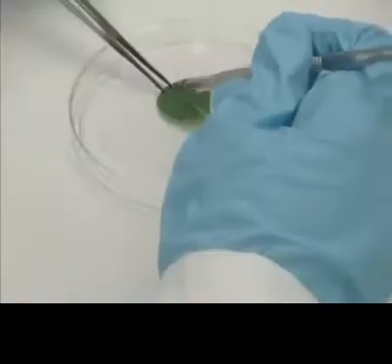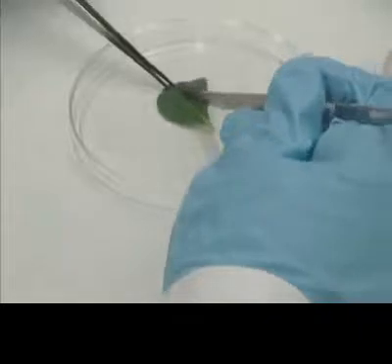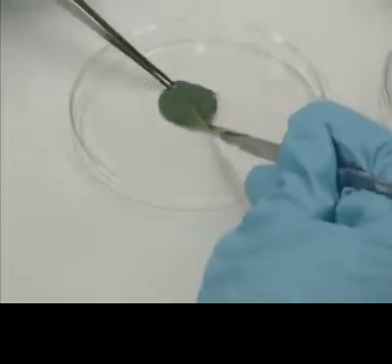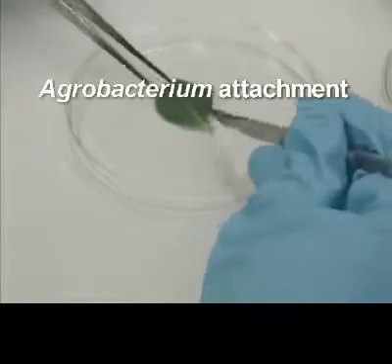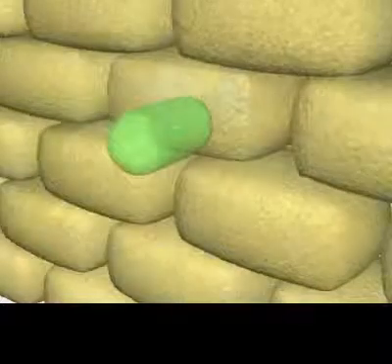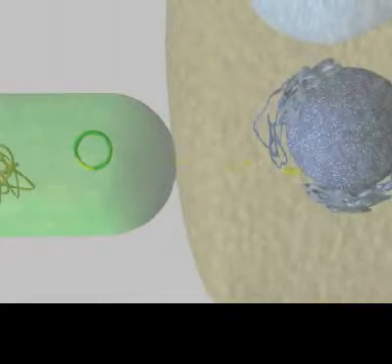Next, explants must be inoculated with Agrobacterium. A scalpel is used to pick a colony from the plate and then wound the leaf of a plant. Agrobacterium then attaches to the plant's cell wall and transfers the T-DNA portion of the Ti plasmid to the host. This T-DNA portion, which contains the genes encoding herbicide and antibiotic resistance, is then randomly inserted into the host's genome.